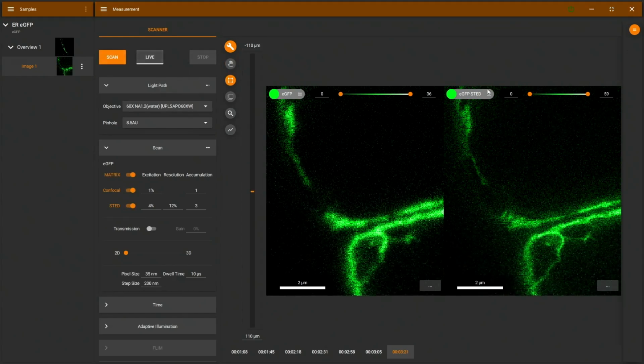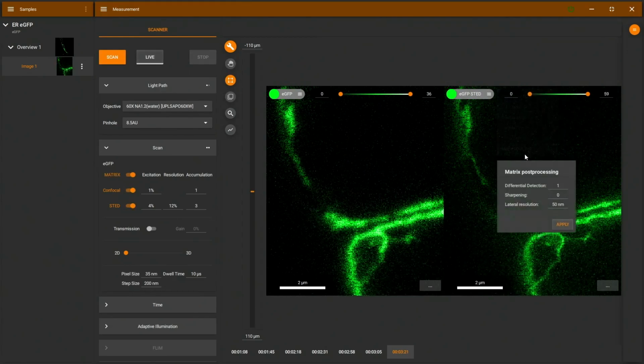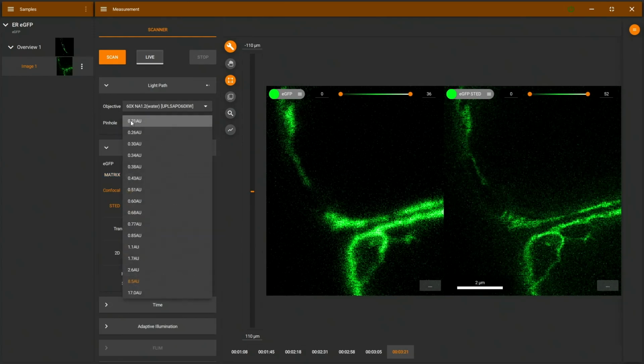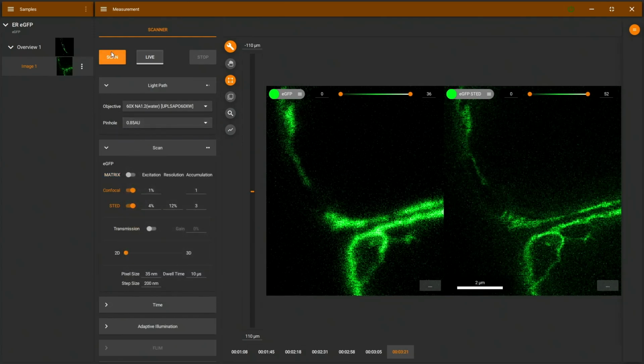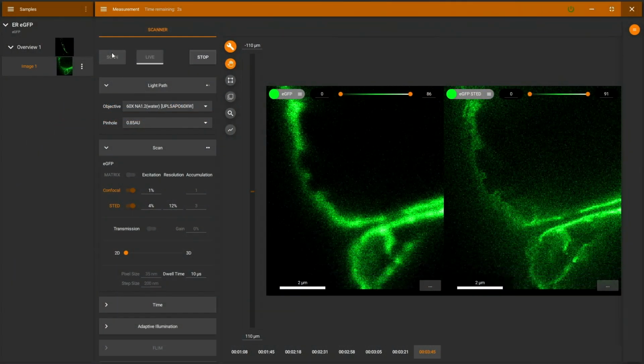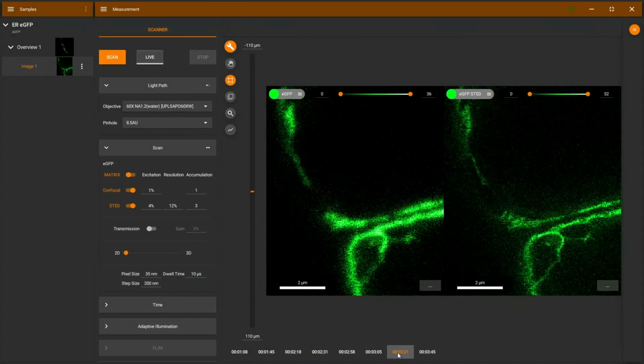There. Now go to post-processing, differential detection, apply, and I think we can see and appreciate the reduced haze. Repeat this exactly without matrix detection in a small pinhole. And in that case, we should be getting, again, much more haze. And you can see this is the case exactly here.